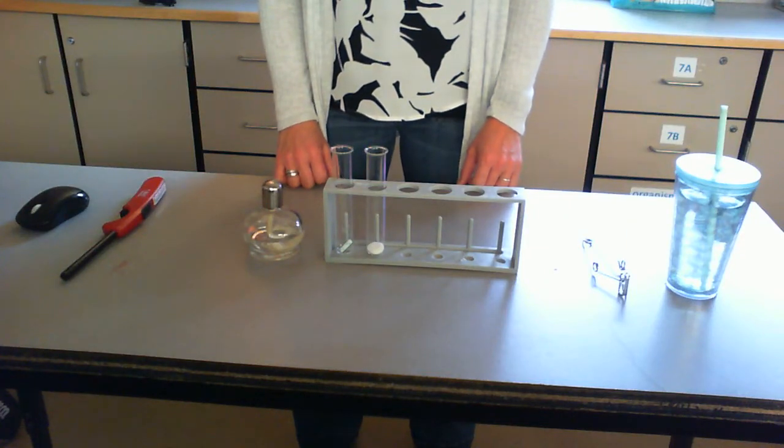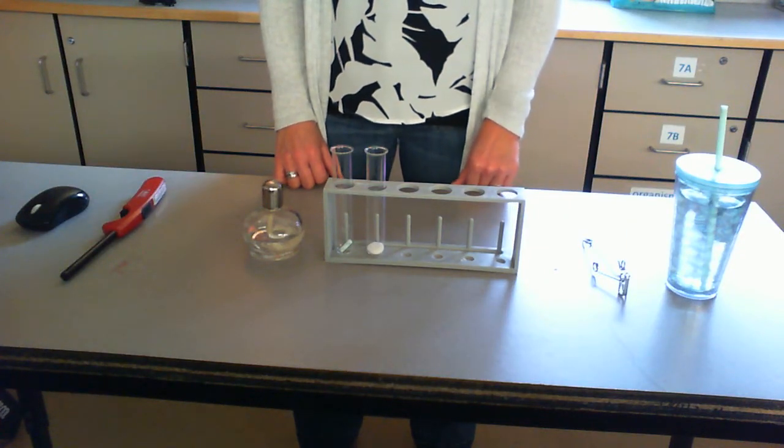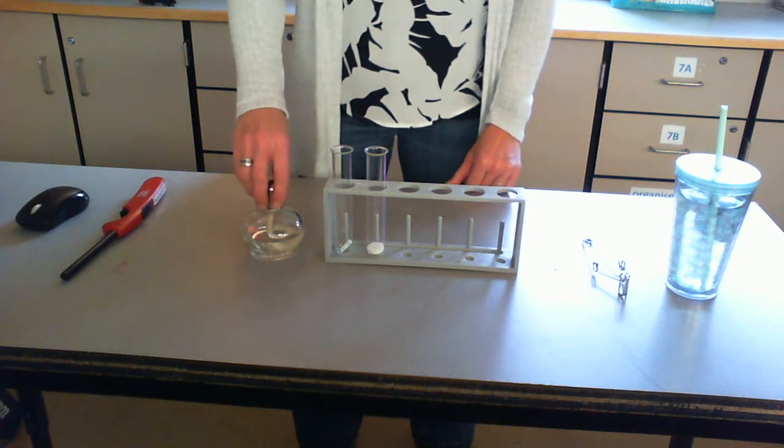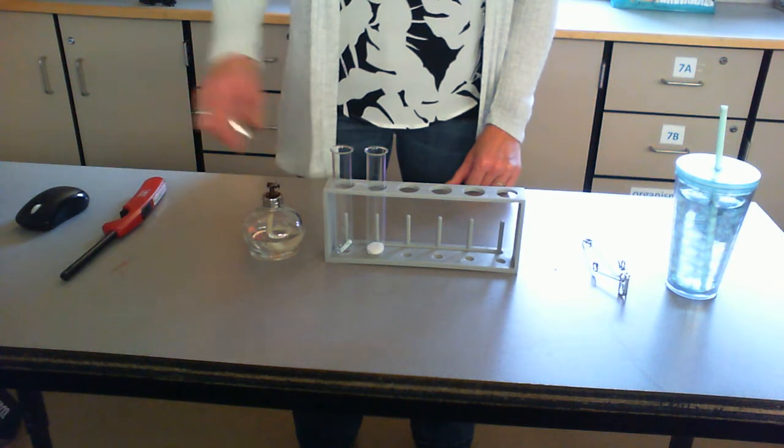Now we're going to see what is going to happen when I heat some sugar and also a piece of a candle. So you wrote down physical and chemical properties for each one of those.